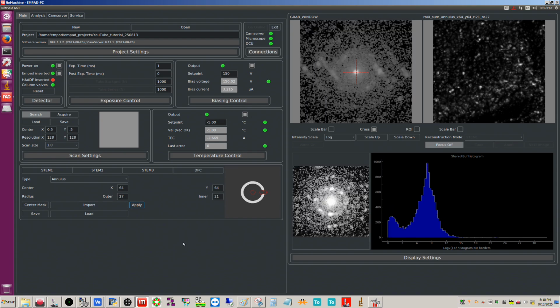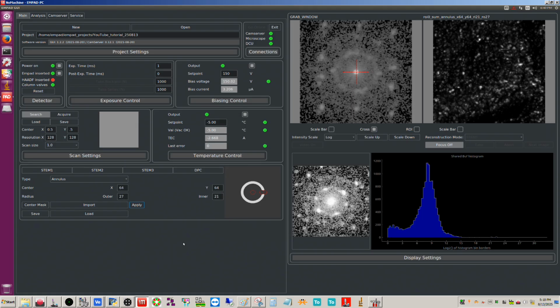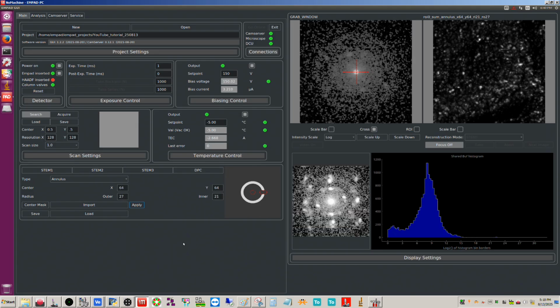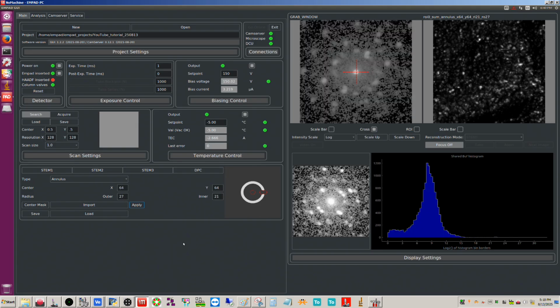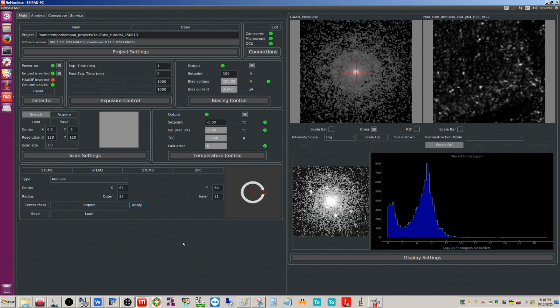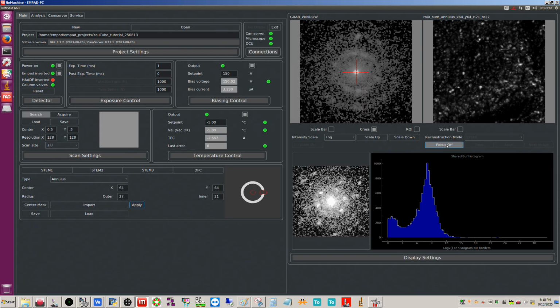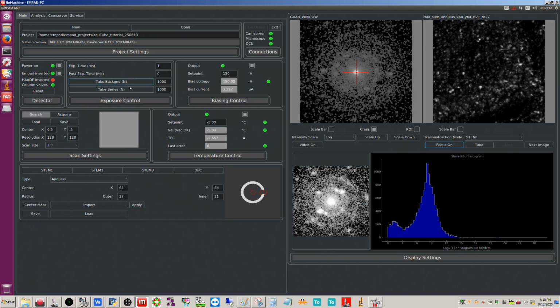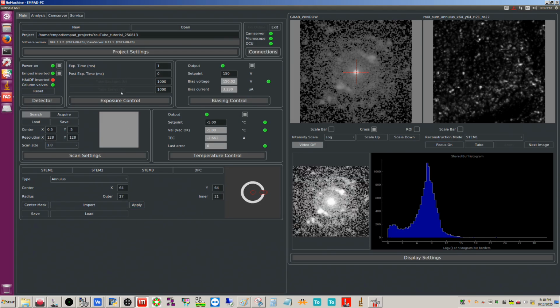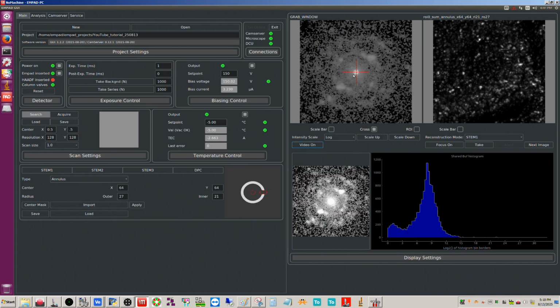So let's see, we talked about the flip upside down of the DP. So then, as far as, let me stop here. You have to click focus off here. Okay, so now you do also, let me do video on. You do also have the option here. Oh, sorry, I have to do this off here. Apparently, you can't have it on while you do this.